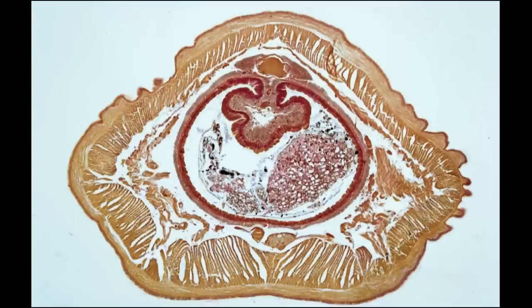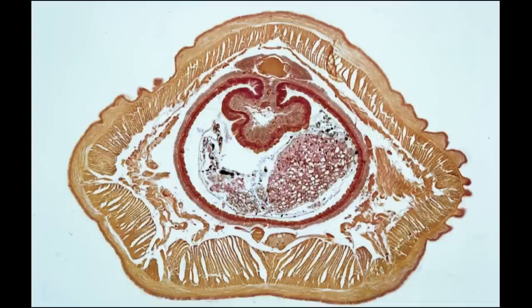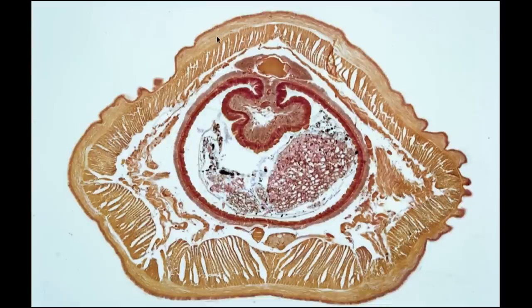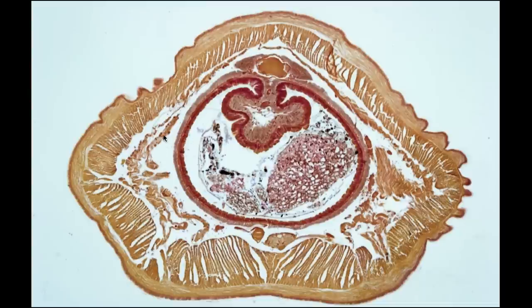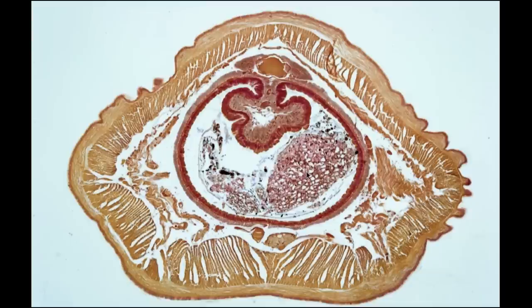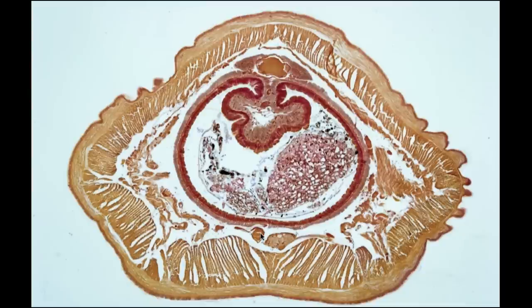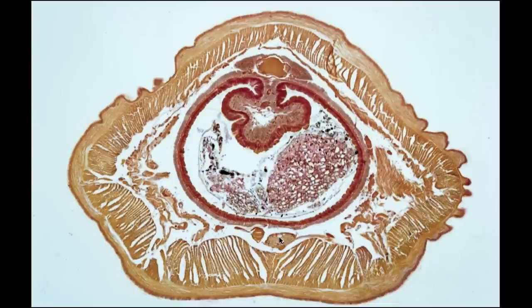Despite differences in appearance, this is also a microscope cross-section of an earthworm, and you can find all the same structures: the epidermis with its cuticle, circular muscle, longitudinal muscle, coelom, metanephridium, dorsal blood vessel, intestine — you can even see some food in the intestine here — the typhlosole, and down here the ventral blood vessel and nerve cord. It's always a good idea to look at two or more slides when studying, since you don't know which one will be used on the lab practical.